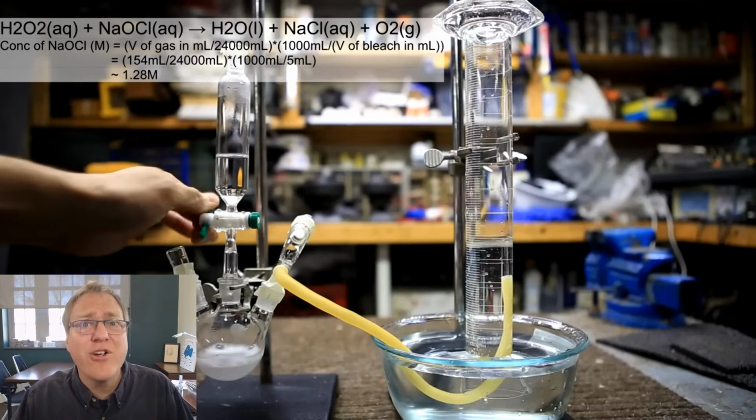There is one big variable in here. He's using 3% hydrogen peroxide. I'm not sure I trust that 3% hydrogen peroxide value either. So, in the end, you have to assume some number is correct. You've got to trust something. So he's going with that 3%, but that 3% can be off as well.